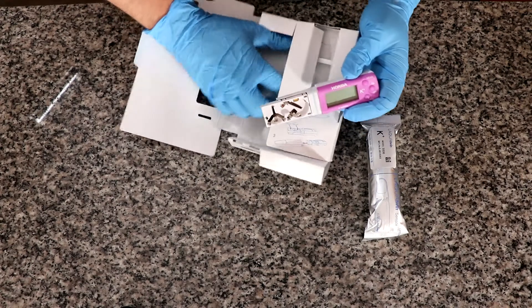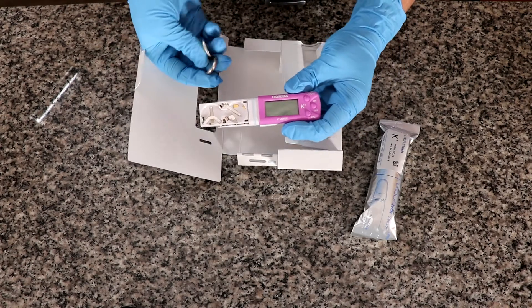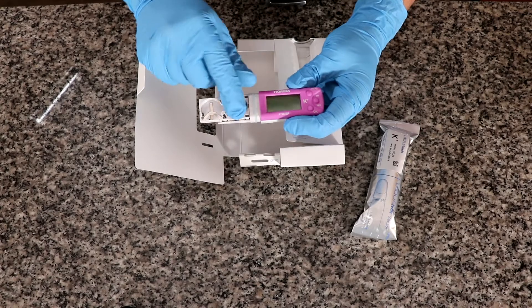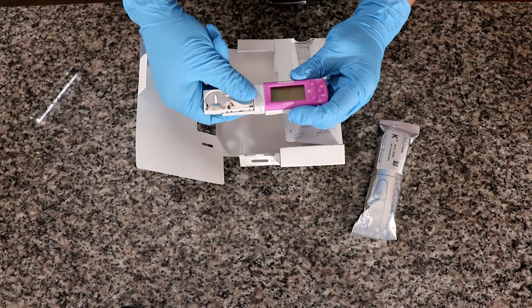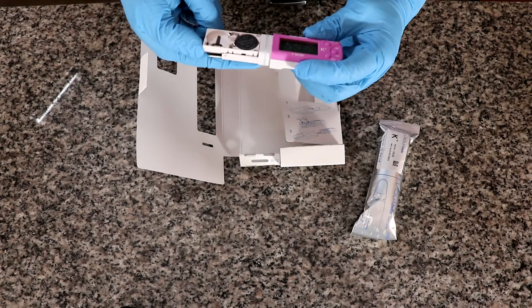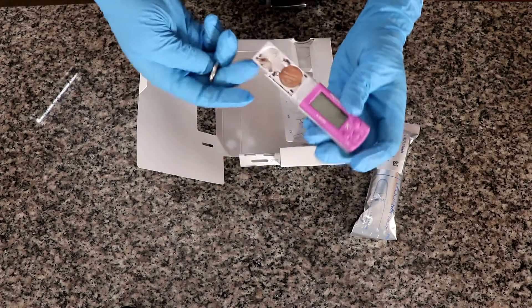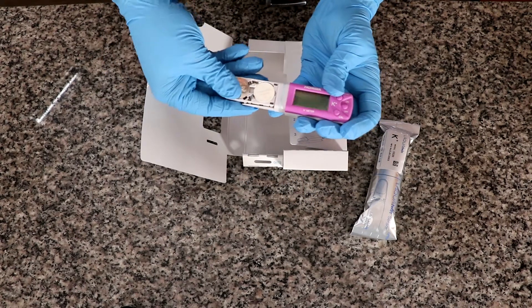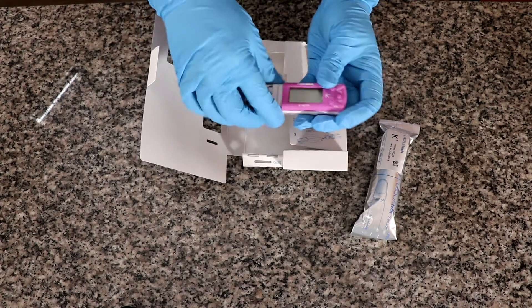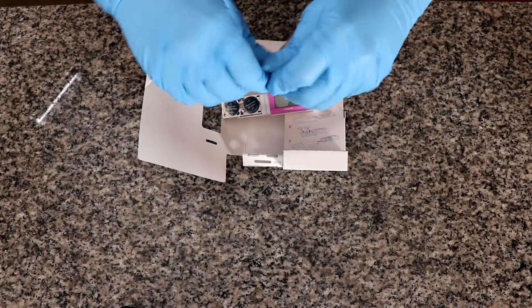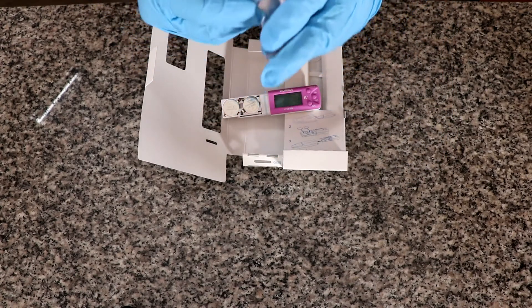So to assemble this you take the two batteries and you put them in with the negative face down so they're in now.